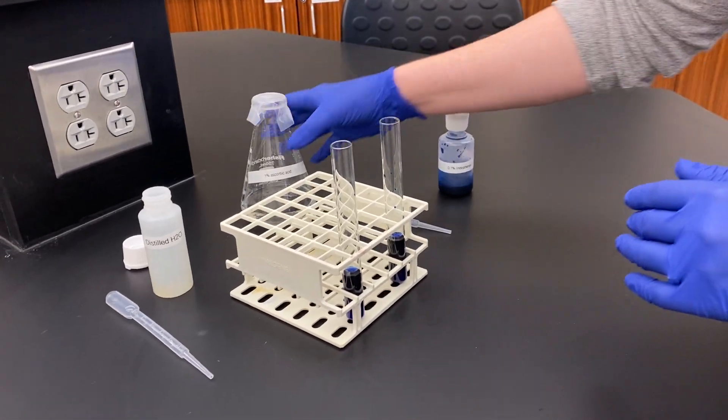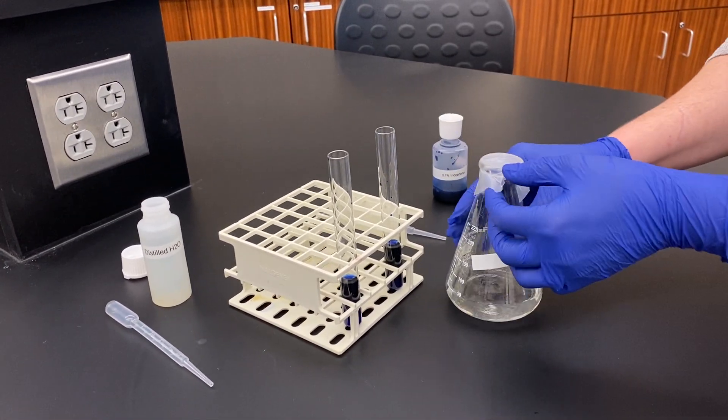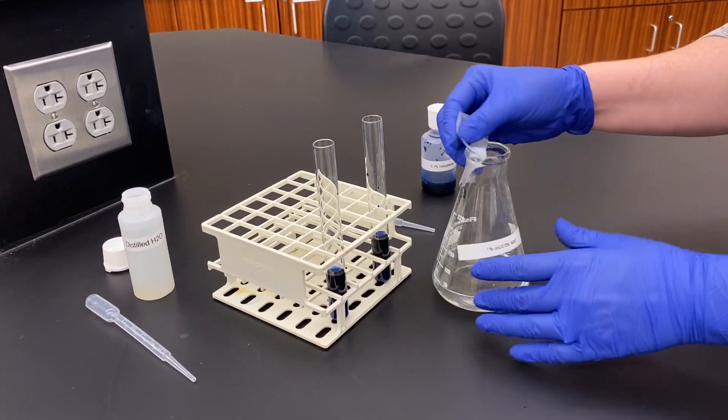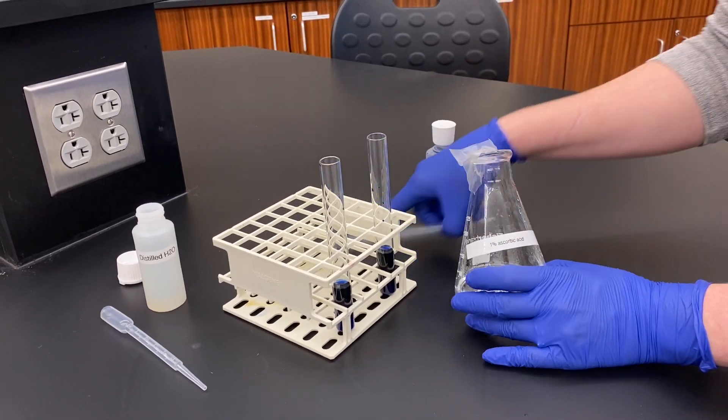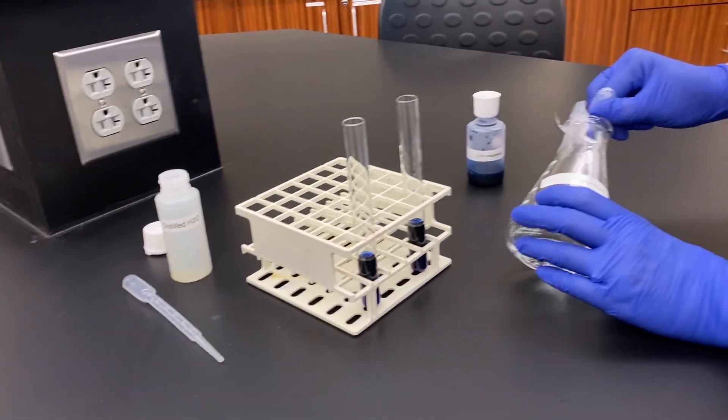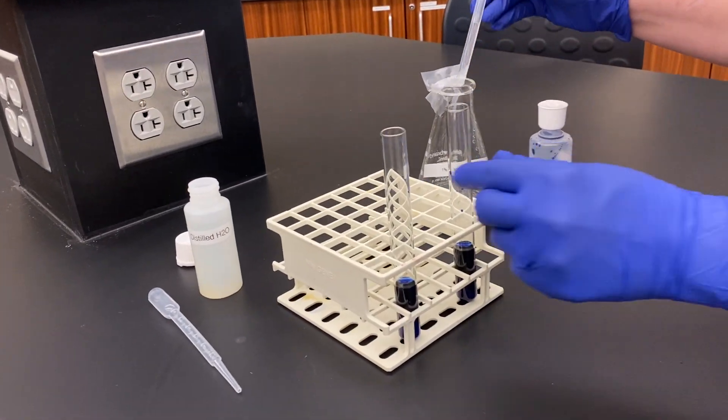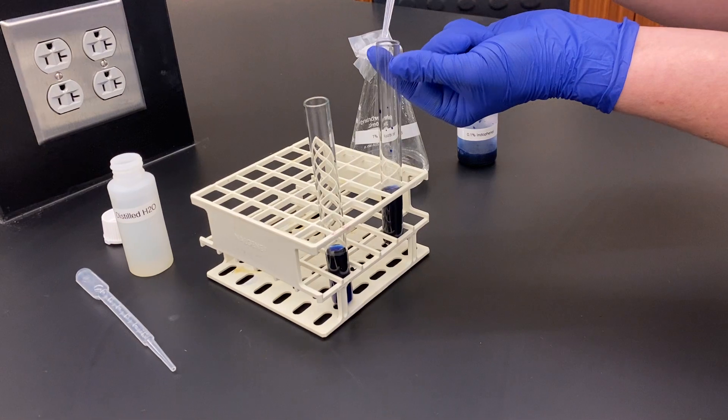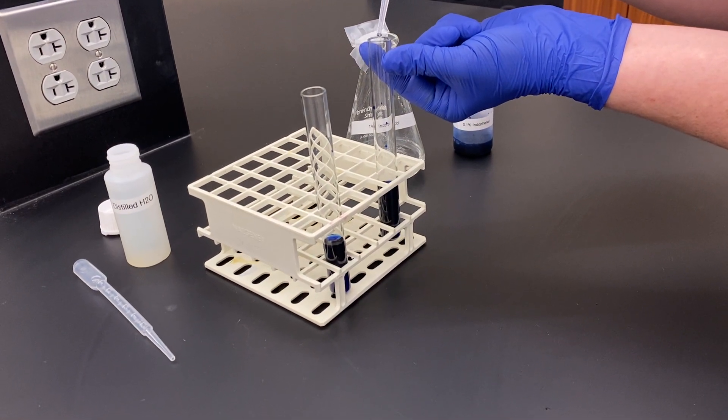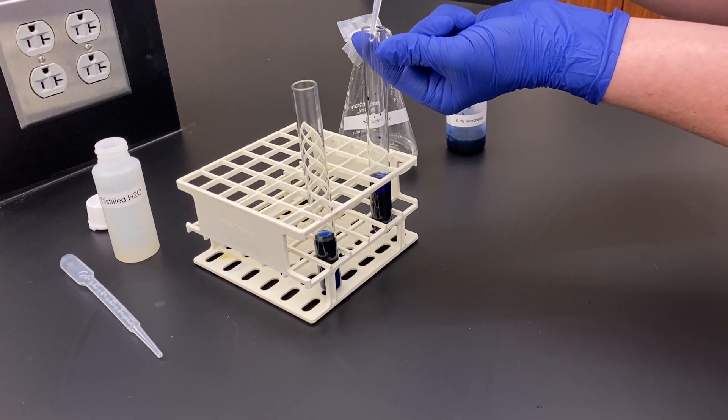This is an interesting reaction because we're just going to keep adding vitamin C and keep mixing as we go until we start to see a reaction. There's no set volume that you're going to use; we're just going to keep adding some vitamin C as we go. I'm going to add a little bit here.